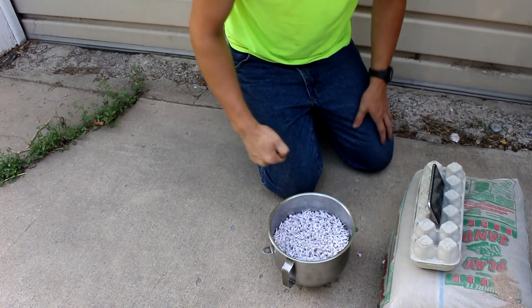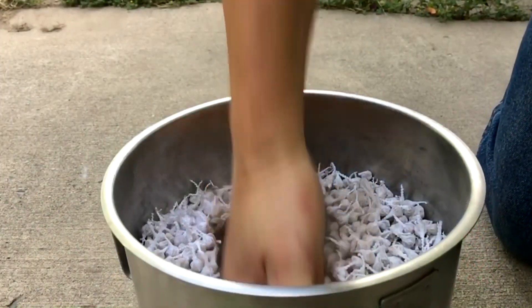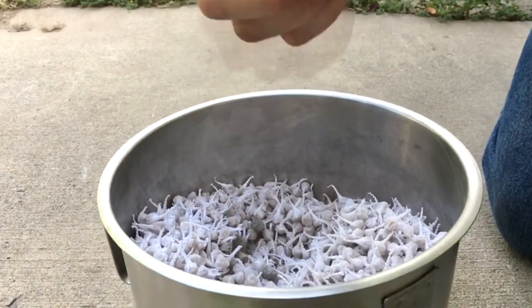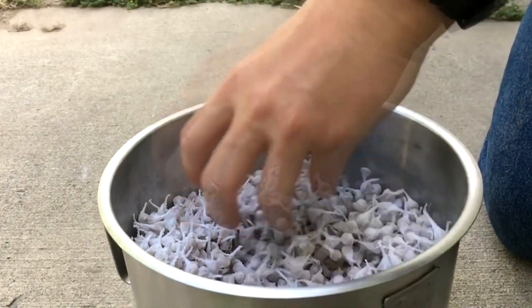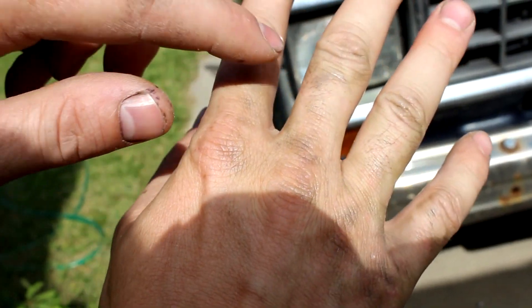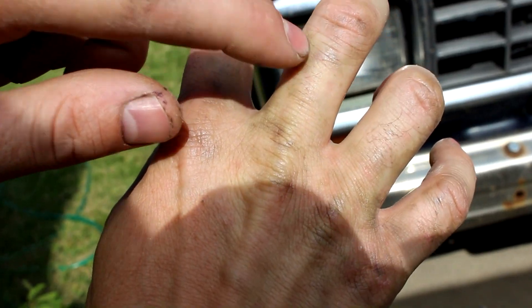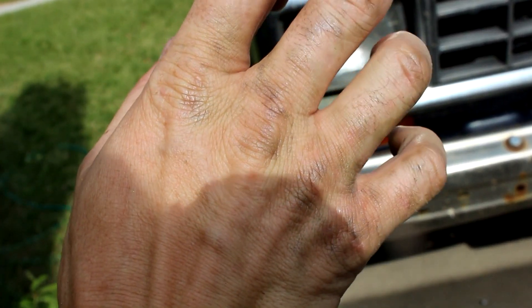Not very much — it's not like they chained together or anything. And that contains all the silver. Look at this on my knuckles. You can actually see where the silver is on my hand, and it's shiny and metallic. That's cool.